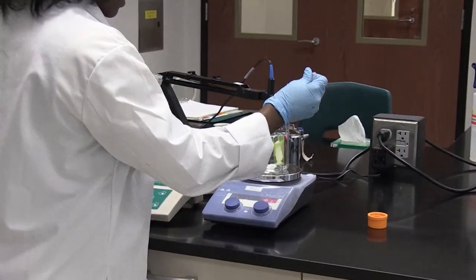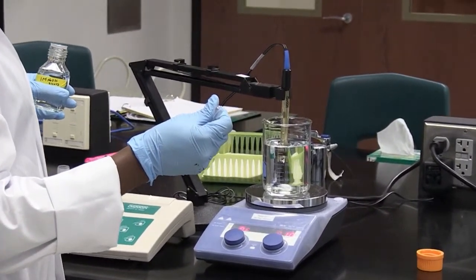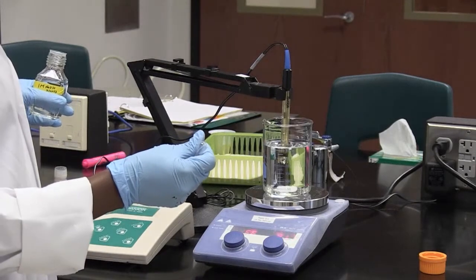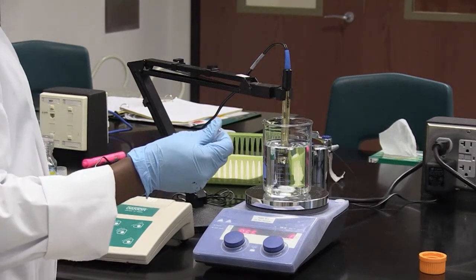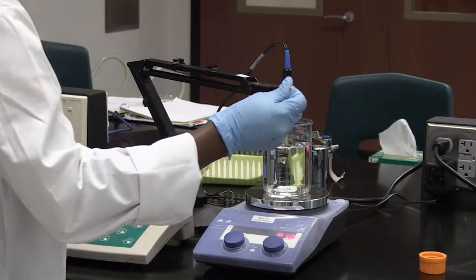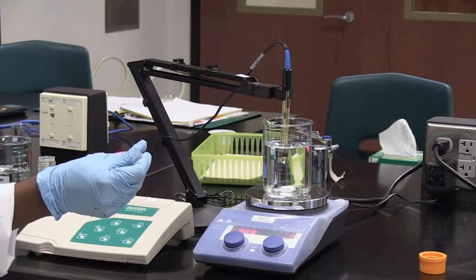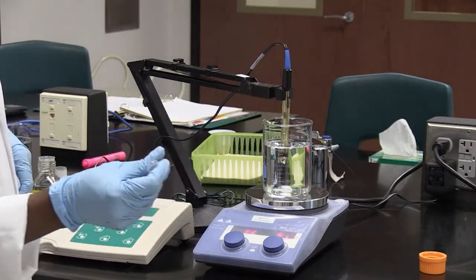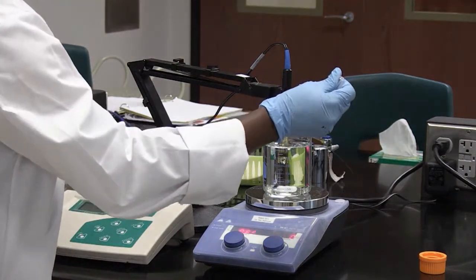I'm going to start off by adding one drop to see if it makes a difference. It's now at 7.31. I add two drops — now it's at 7.38. You continue doing that, adding a drop or two at a time until you get up to 7.7. You don't want to add too many drops at one time because you could go above 7.7 and then have to adjust using hydrochloric acid, which you don't want to do because that would alter the buffer you're making.